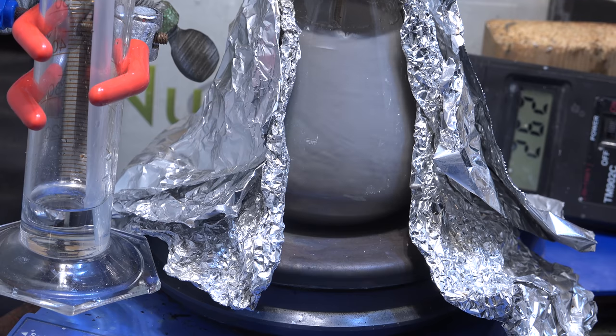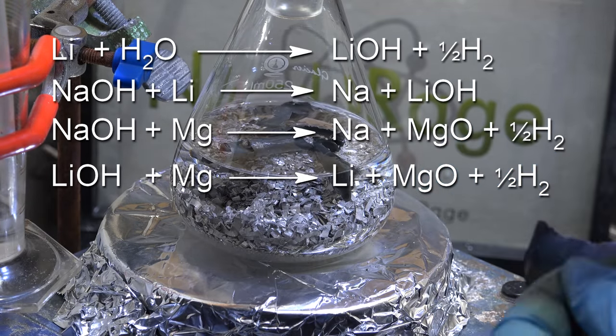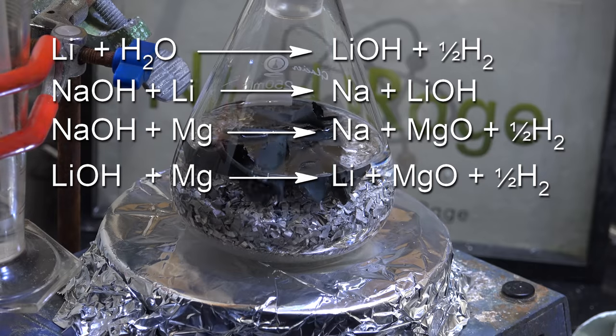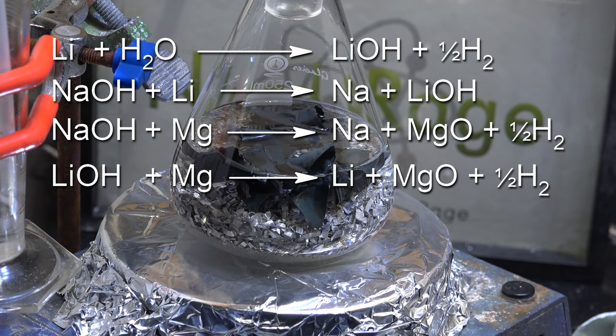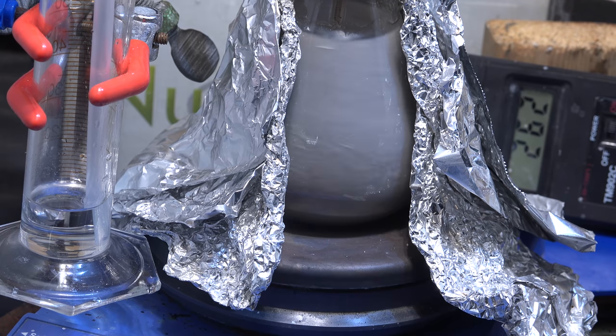Now an important benefit of lithium formation being impossibly slow is that this would make lithium contamination in our sodium production experiments negligible. In the original experiments, a small amount of lithium metal could be used to jumpstart sodium production by reacting with excess water and drying out the sodium hydroxide. The lithium also converts into sodium by metal displacement. Then as temperature is brought up to operating temperature, the sodium production is taken over by the magnesium. It was thought at the time that when the sodium hydroxide ran out, the lithium would be reformed by the magnesium. But now that we know that lithium formation is impossibly slow, and doesn't even happen at 200 Celsius, there should be negligible lithium contamination. So we can be confident that our sodium produced is relatively pure.